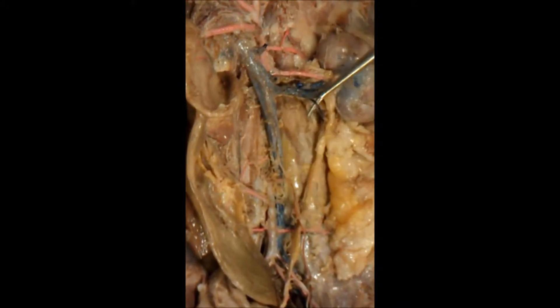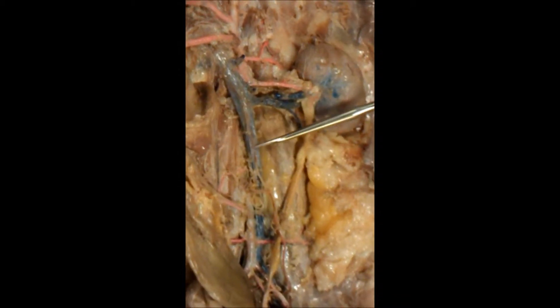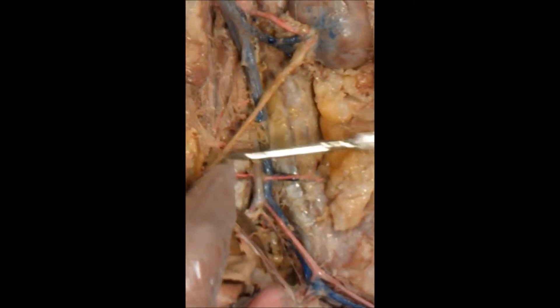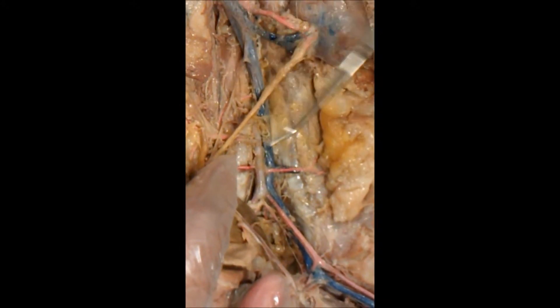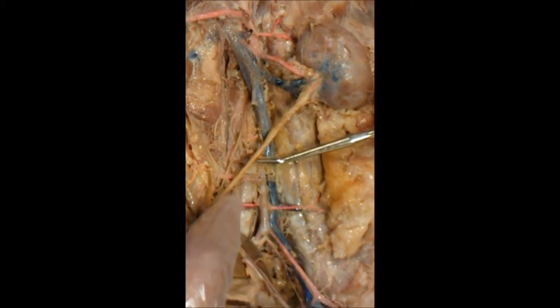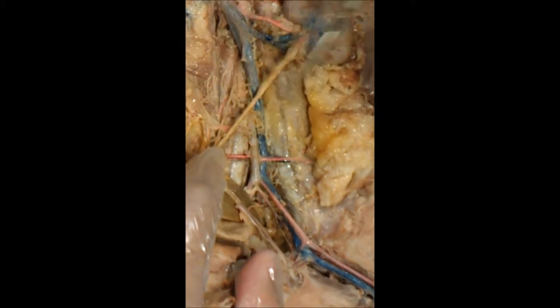This is a gonadal vein on a male cat. Moving down, if this was a female cat, you would have the gonadal higher up, right about here. Extending laterally, you would have another gonadal vein, both left and right.